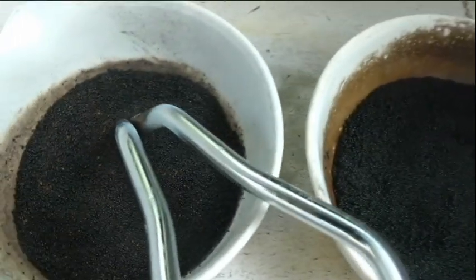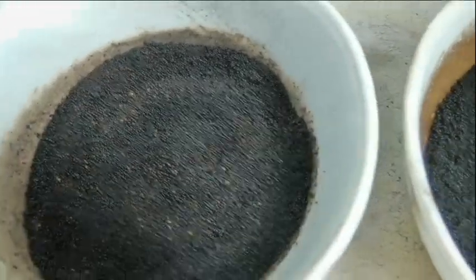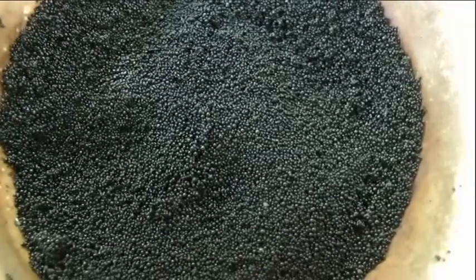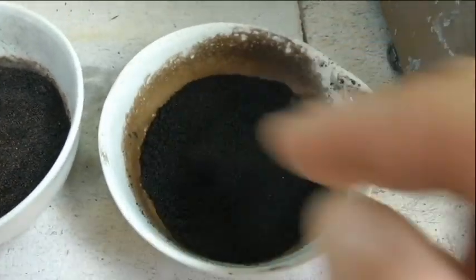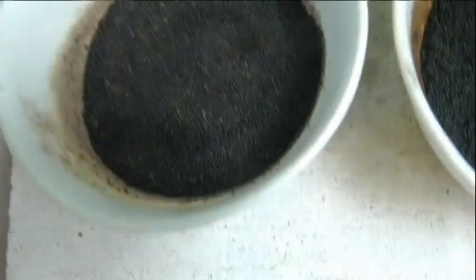Maybe that one's not quite cooked enough. I'll put it back in a little bit longer, but I don't know if you can see that there, can you? See the colour of it? And this one here is just all black. So maybe because that one was nearer to the back of the coils, it might have cooked a bit. It looks like it's pretty well done. This one might need a little bit longer, just because of the colour of it, that's all.